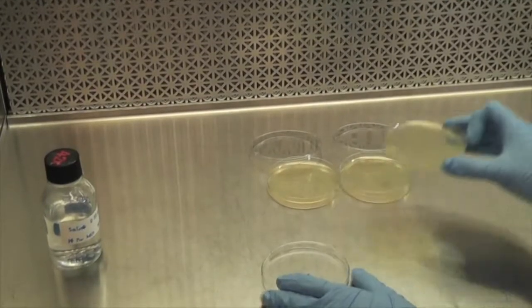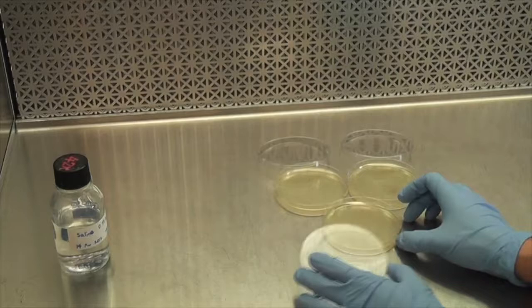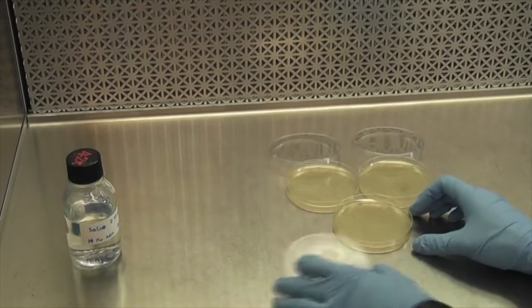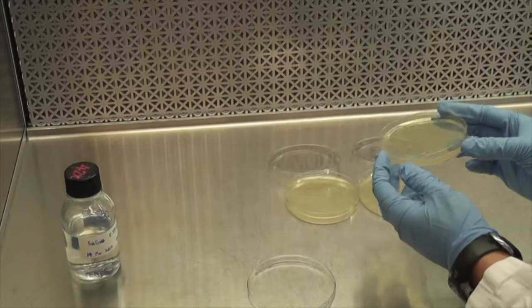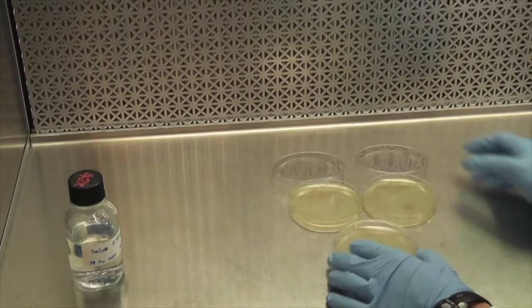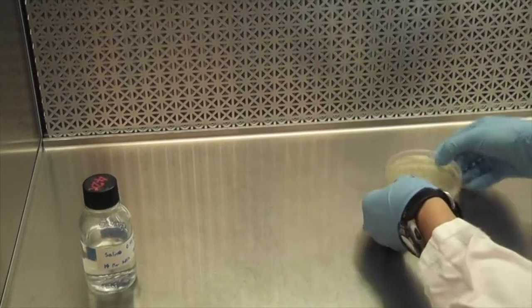Let the media solidify. This usually takes 20 minutes to 30 minutes. Replace the lid inside the laminar flow hood and clean up your work area. If performing this on the benchtop, cover the lids of all plates. The plates will likely take longer to dry. You may leave them out overnight to allow them to solidify.